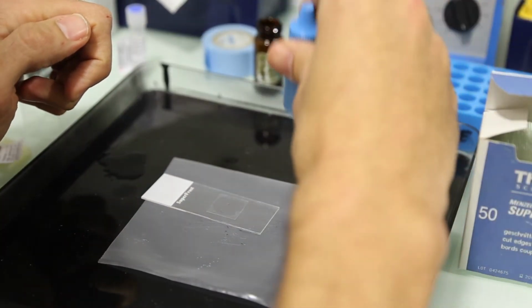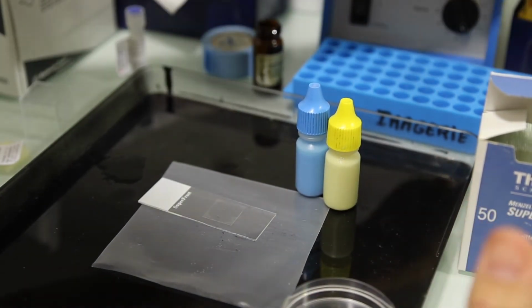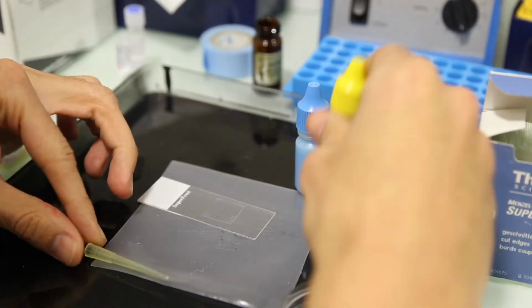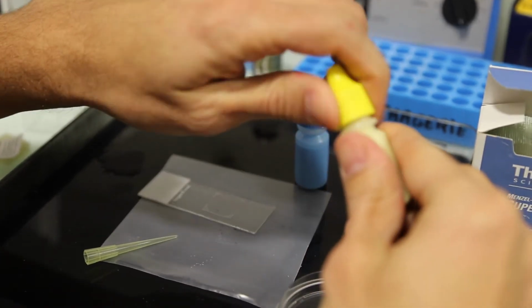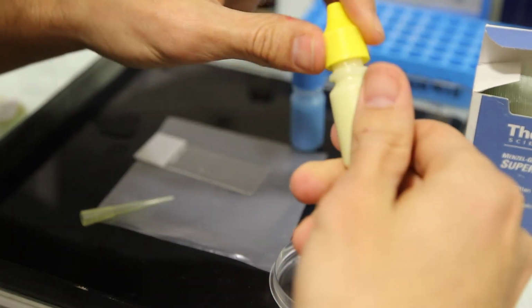We use dental silicone to seal the gap between the cover slide and the microscope slide. Dental silicone is chemically neutral and does not damage the system optics, unlike the more widely used nail polish. For long-time conservation, keep the slide stored in the fridge and protected from light.